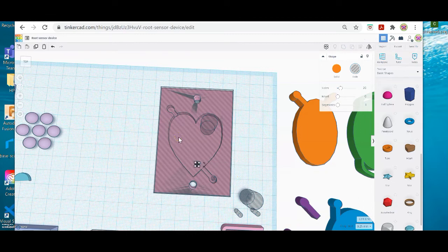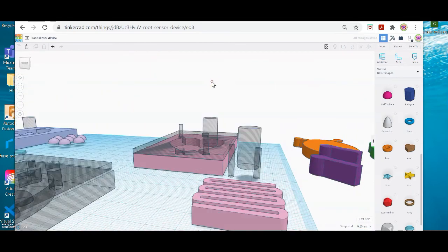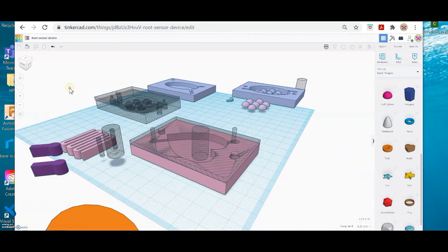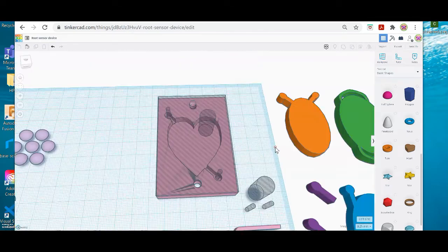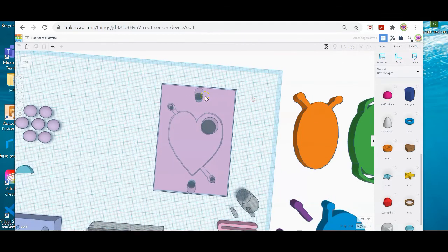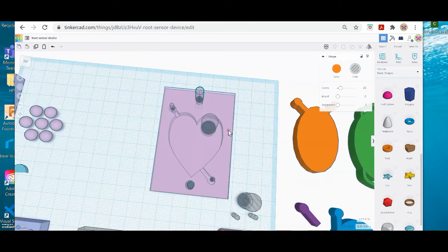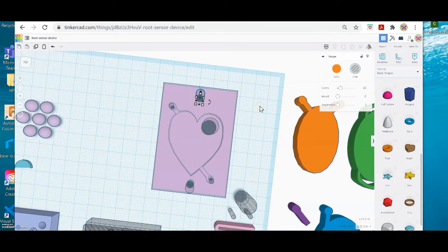So again, what you want to put on the lid are 2 port holes that go into the little port areas and 1 hole to drop in the seed. Okay, so I have all 3 of those there. I think, let me see about the alignment. So I'm just going to orbit around the whole thing and make sure it's pretty much aligned. I think my only challenge is this particular cylinder here doesn't look quite aligned. So I'm going to ungroup my base plate, and I am going to go sideways so I can grab just that 1 cylinder hole. And I'm just going to move it down until it seems aligned.